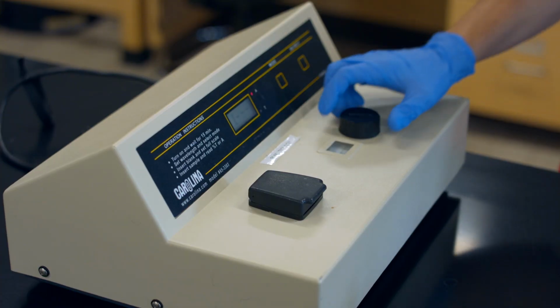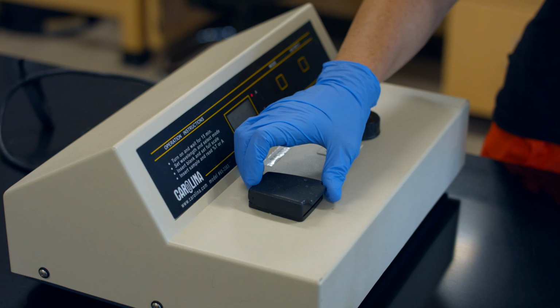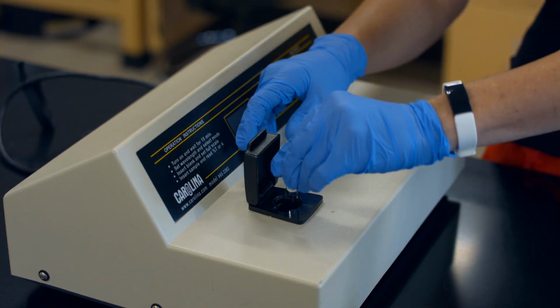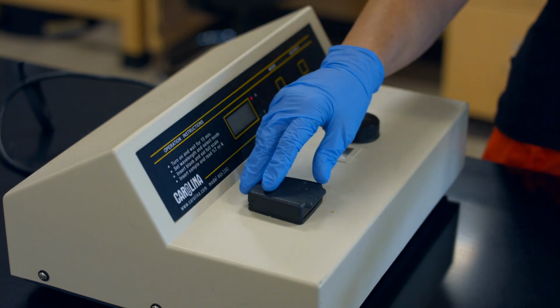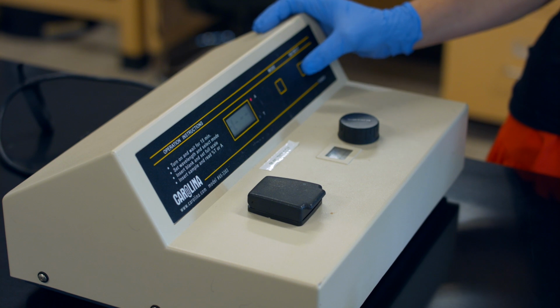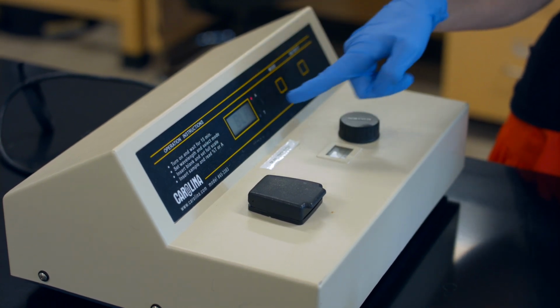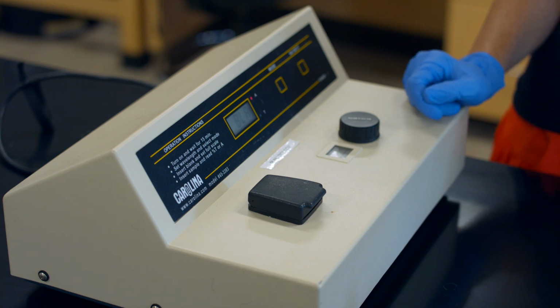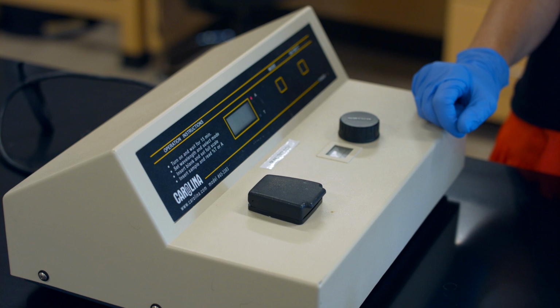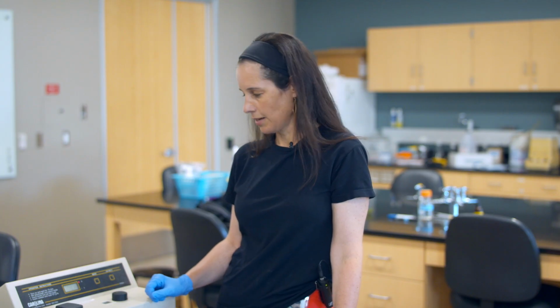So I've set the wavelength to 640 nanometers, and we're going to go ahead and put our blank into the machine. So for us, the blank is whatever you dissolved the copper sulfate in, which in our case happens to be water. So I'm going to go ahead and blank the machine by pressing the button on the right. So now it's blanking, and you'll see it says BLA for blank. It will flash, and once it gets stabilized, then we'll know that it's properly blanked. So we'll give it a second to do that.